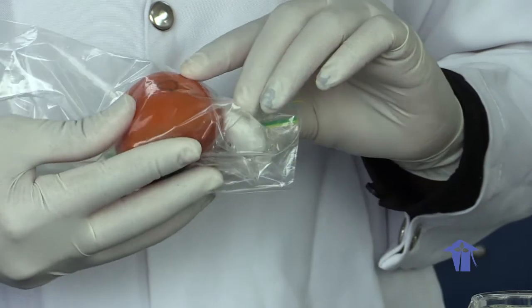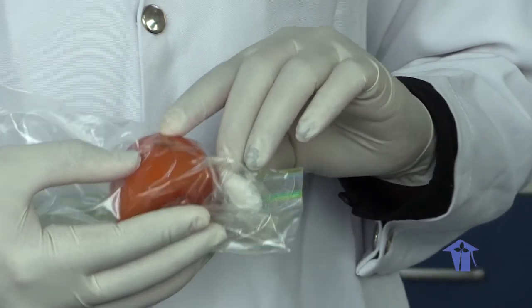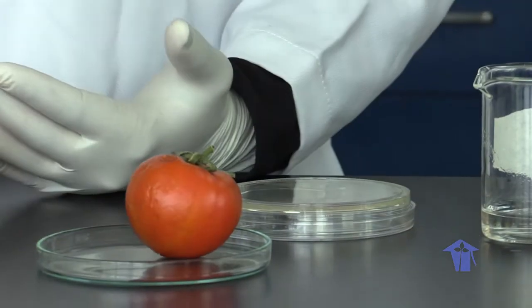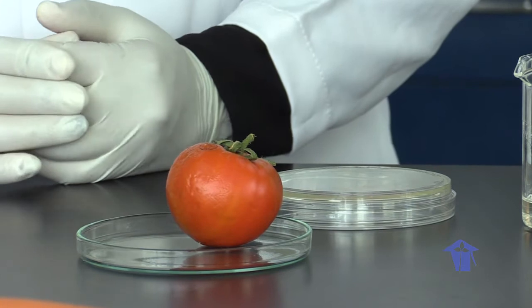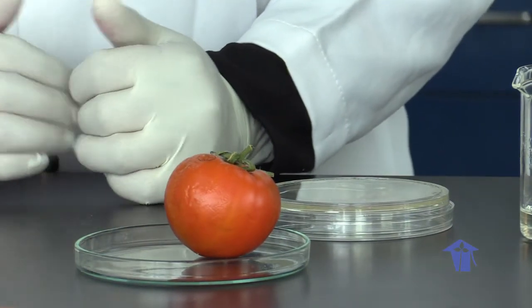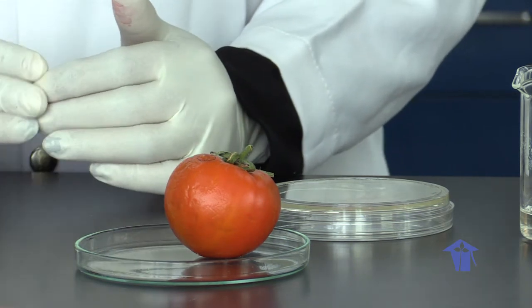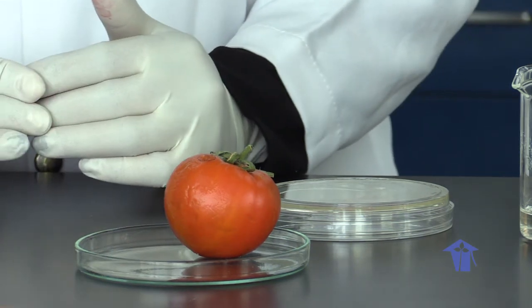During this period of time, you're going to come in and look for signs and symptoms as the days go along. And that's it for the second session of your lab for Koch's postulates. The causal organism was isolated in pure culture, it was described, and a fresh fruit was re-inoculated with that organism, as well as a control for observation.